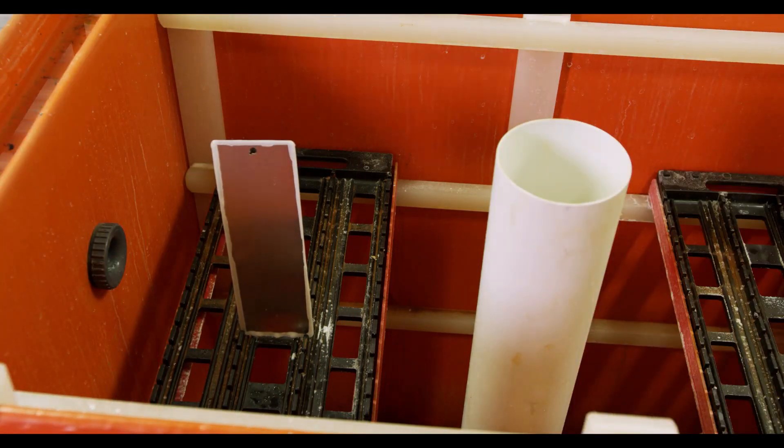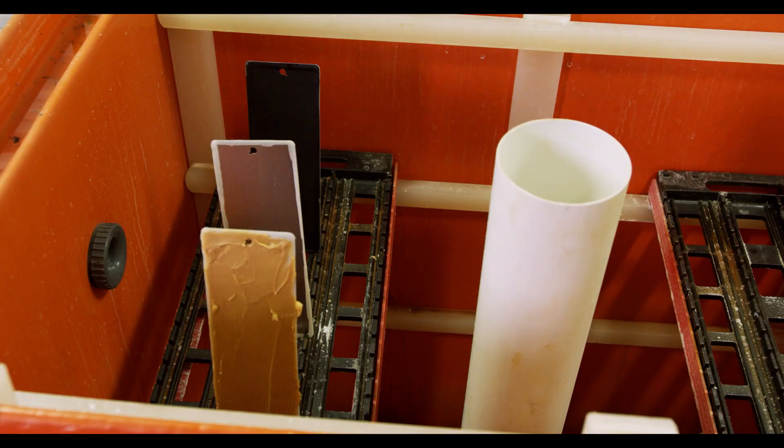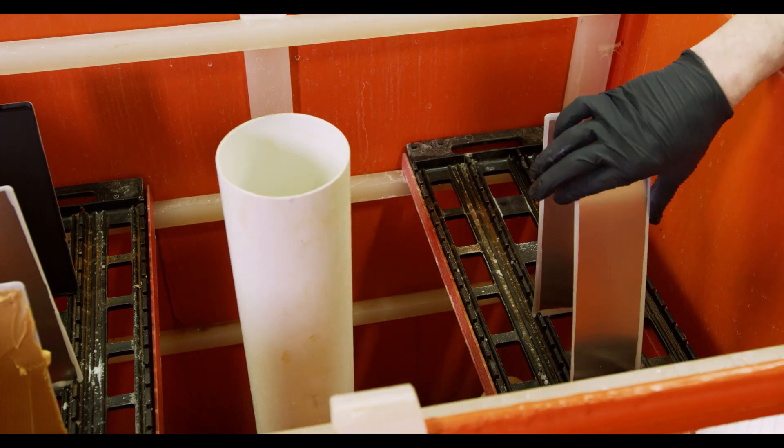If we take a look inside, just to walk you through what we're going to do, we're going to take our various samples and we're going to set them up here on this rack, lined up one by one.